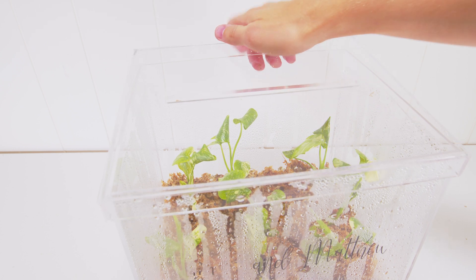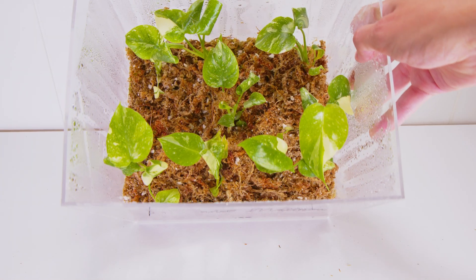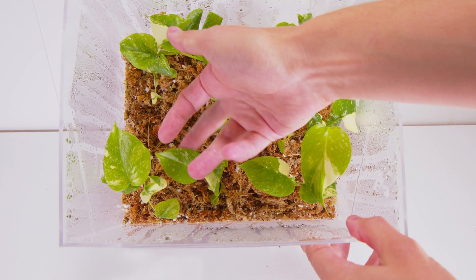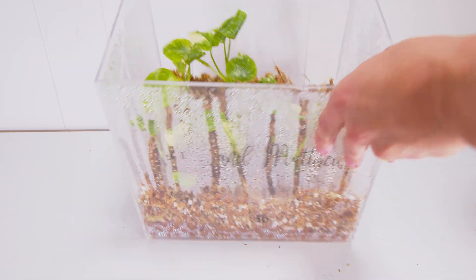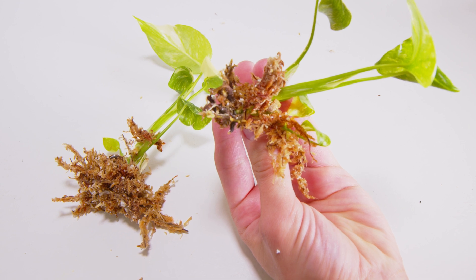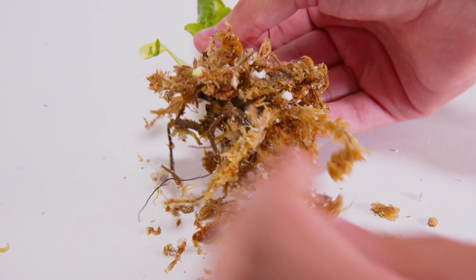Moving about 10 more days later, you can see all kinds of new progress. From the very surface, everything looks great, nothing's falling over. The 100% humidity is really important, and good light is really important. These are variegated plants, so they're already somewhat disabled in a sense where they don't have total chlorophyll capacity — they have a lot of white patches. So they already can't produce energy like a normal Monstera would. Good light is important, 100% humidity is important, and lots of moisture.